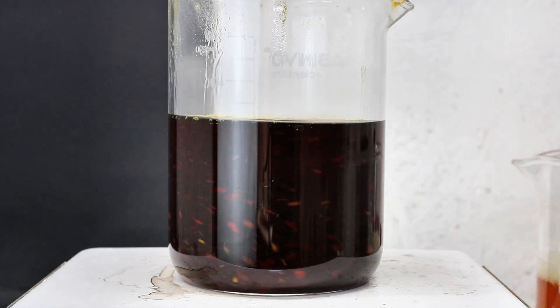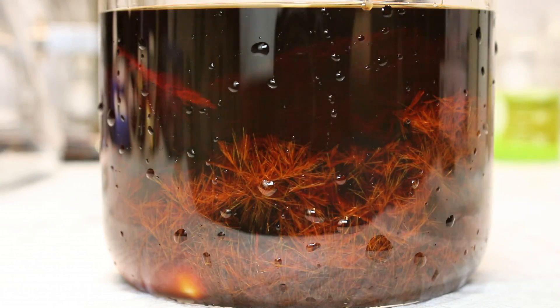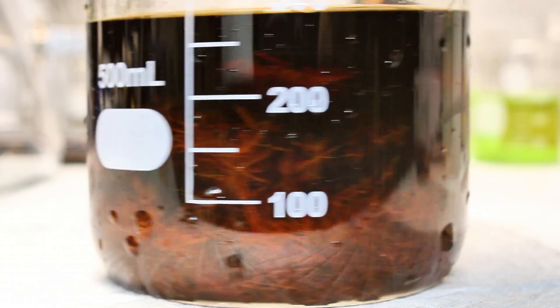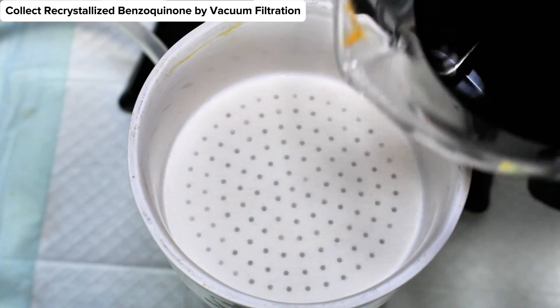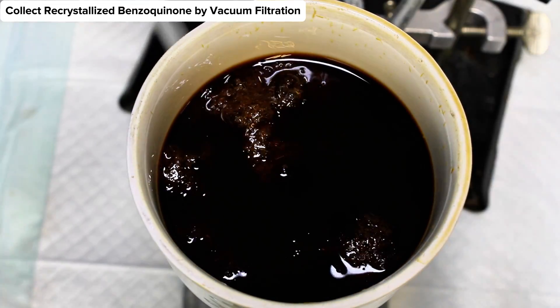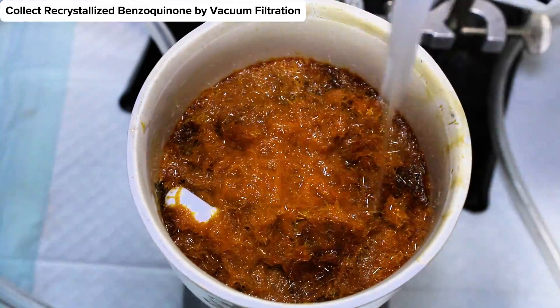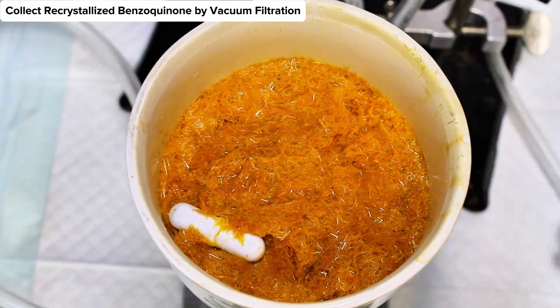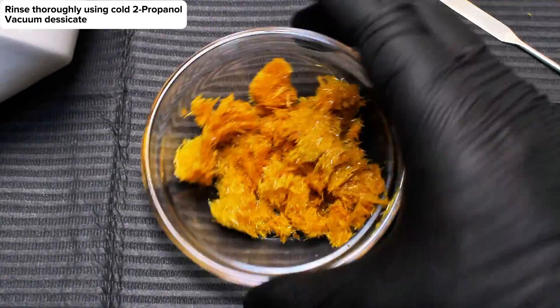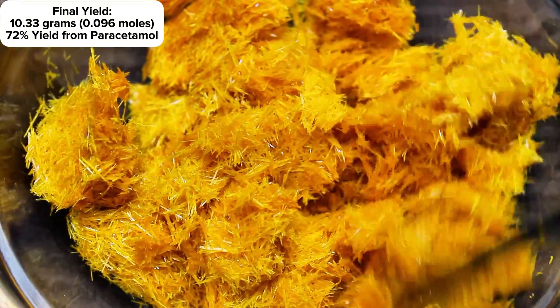This was placed on my hot plate and brought up to a boil under constant stirring to dissolve the benzoquinone. I then took the beaker off the heat and placed it on an ice bath to crystallize the product. Unfortunately the solution was too dark to record this happening — it's a shame, because these crystals looked particularly beautiful once enough had formed to actually see them. Once the recrystallization mixture cooled to 0 degrees Celsius, I broke up the crystals and collected them by vacuum filtration. These were rinsed thoroughly several times using additional cold isopropanol, then transferred to a dish and vacuum desiccated overnight. I then weighed my dry benzoquinone crystals for a final mass of 10.33 grams, representing a 72% yield. This was pretty good, but I feel this number would have been higher if I didn't let the reaction go overnight.